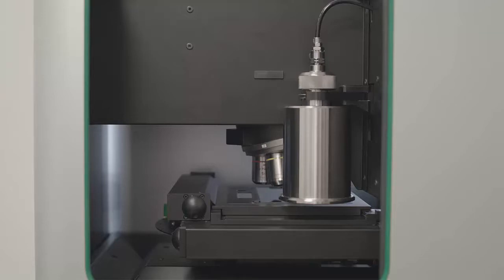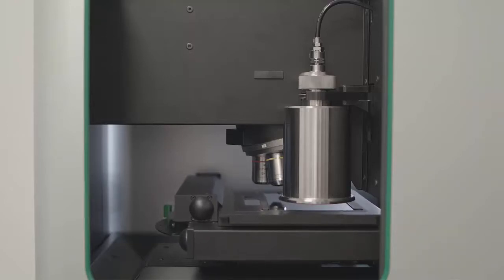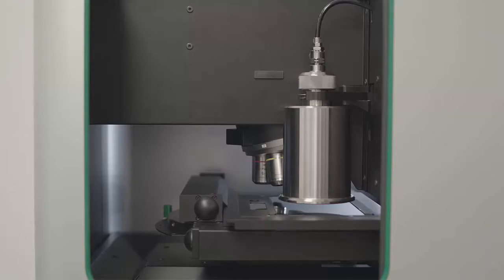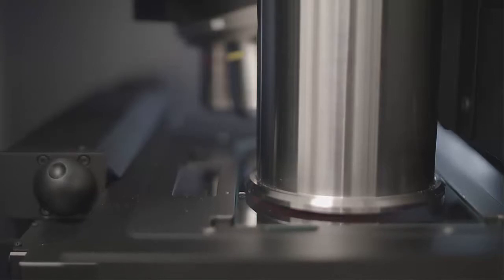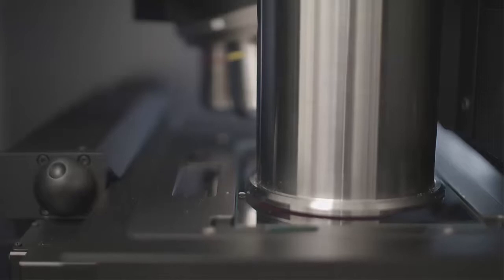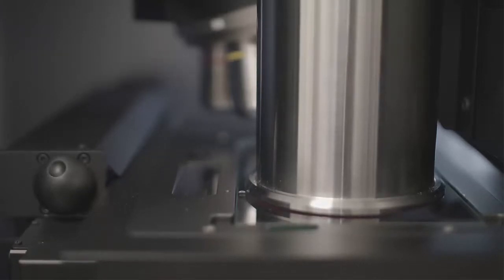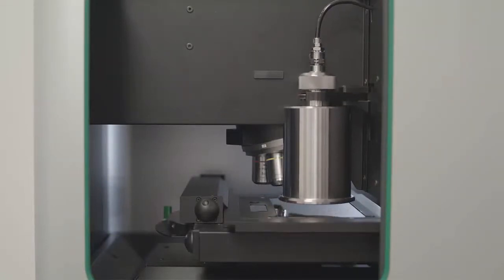The system then checks that the dispersion plate is in place, and the stage then moves to the sample dispersion position. Both the sample dispersion chamber and stage are moved together to form a seal. Compressed air is then injected into the SDU to disperse the sample, and after a settling time, the SDU chamber is lifted to reveal the dispersed sample.